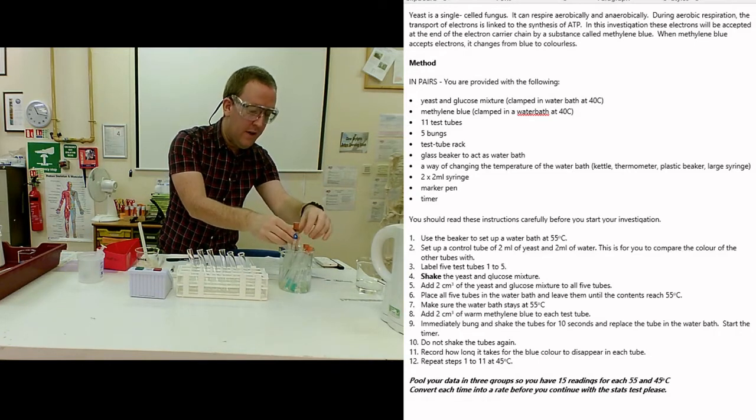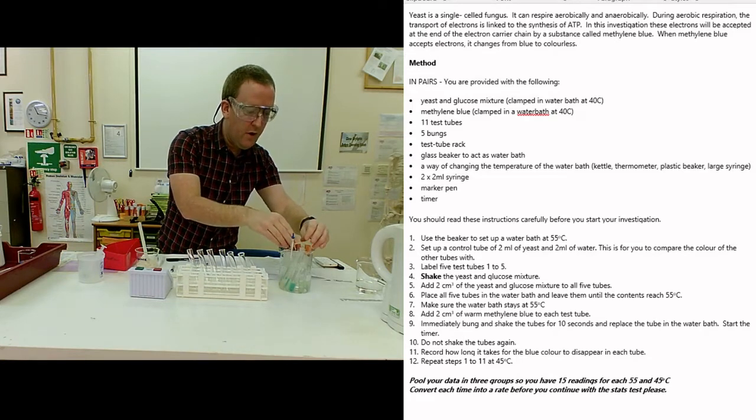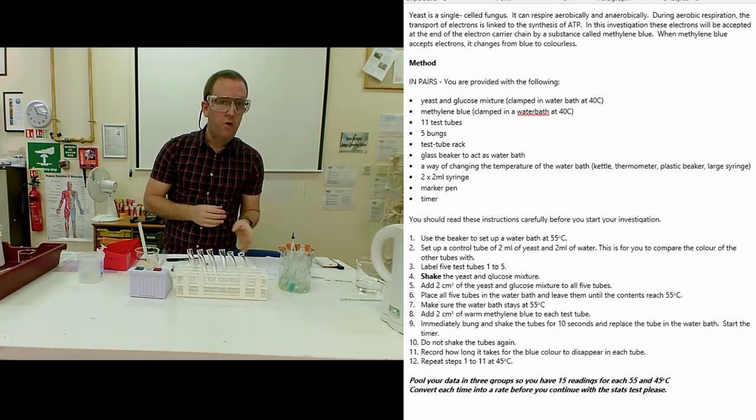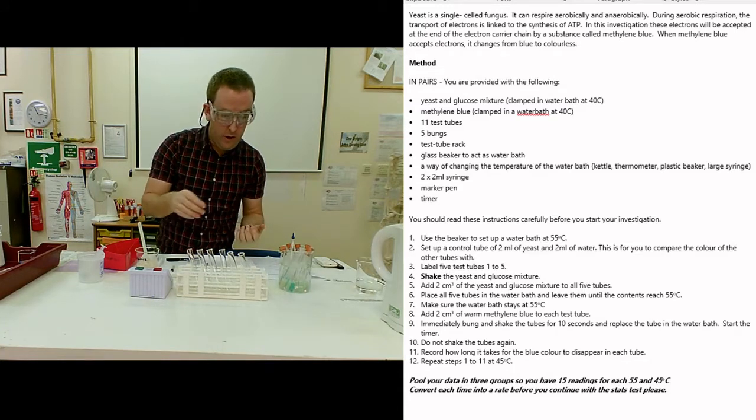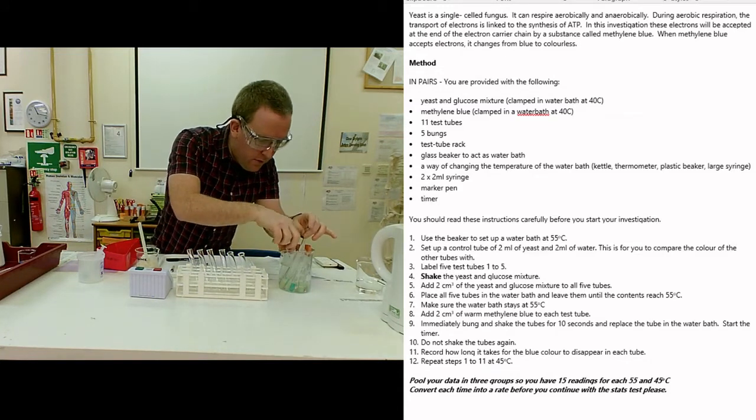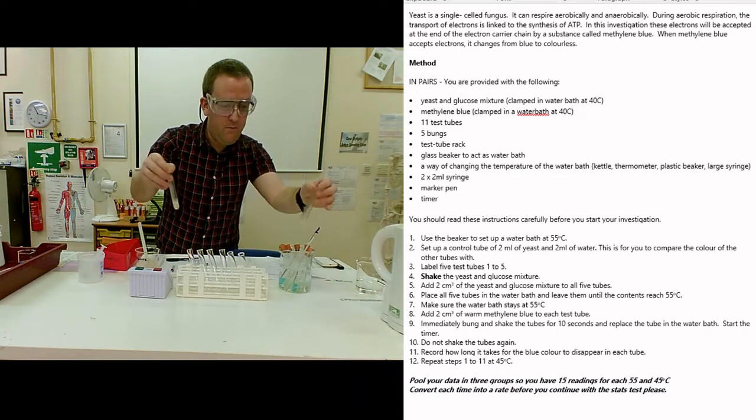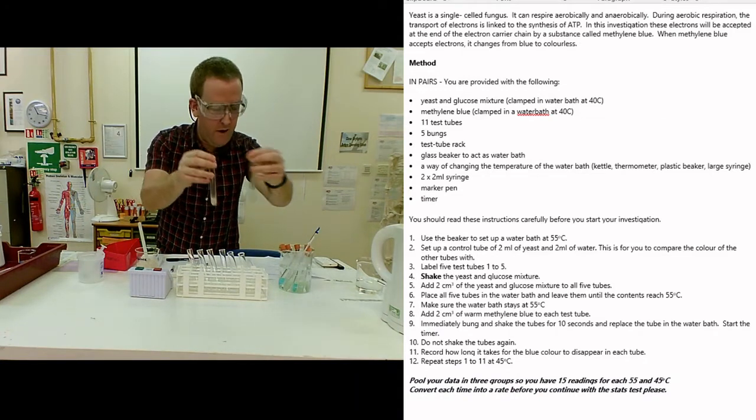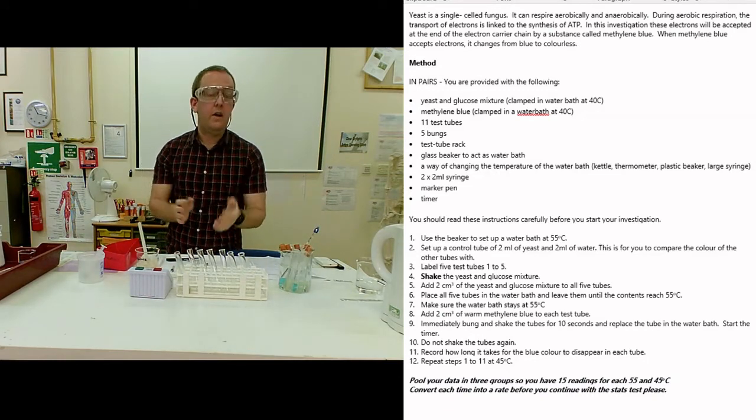Checking back on these, there's immediately been an amount of decolorization going on, but you have to keep checking them, keep monitoring that temperature until you get full decolorization, until we end up with them looking like our standard. Keep comparing until we get complete decolorization.